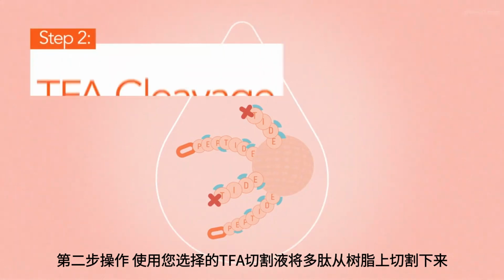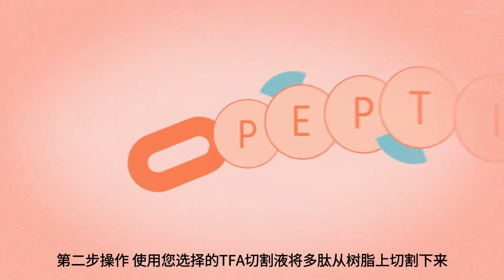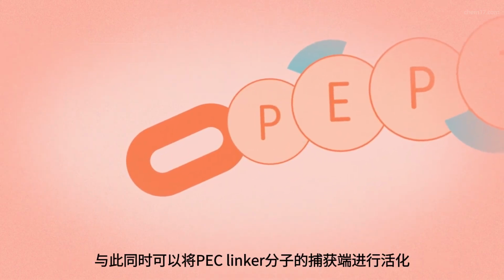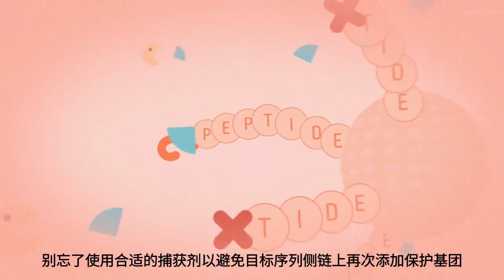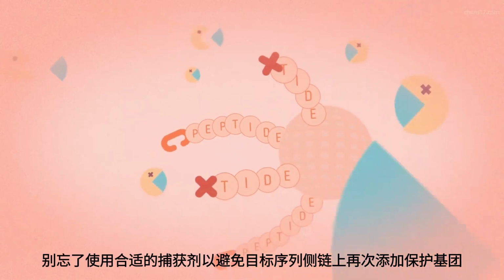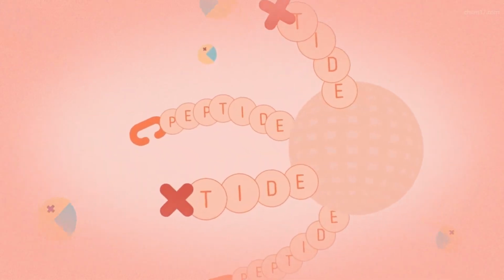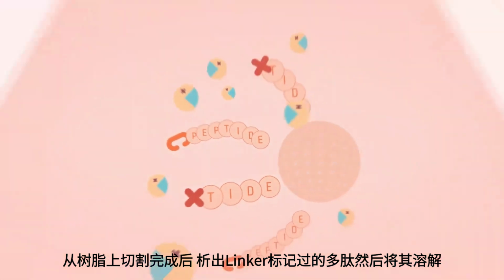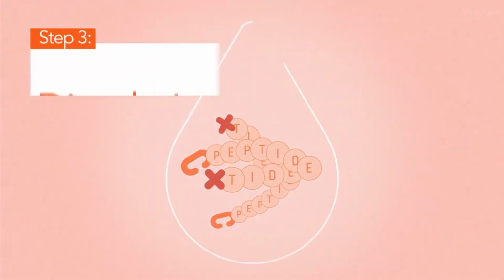In the second step, cleave your peptide from the SPPS resin using a TFA cocktail of your choice that, at the same time, activates the PEC linker for the catch step. And don't forget to use scavengers to prevent the re-addition of protecting groups on your target sequence. After cleavage from the synthesis resin, precipitate your linker-modified peptide for the dissolution step.